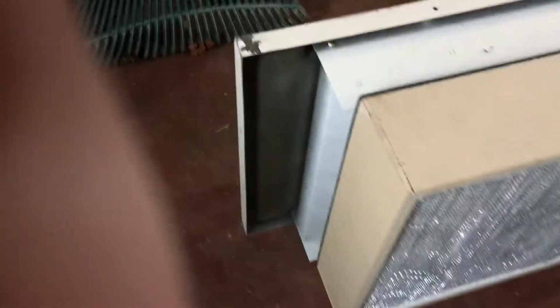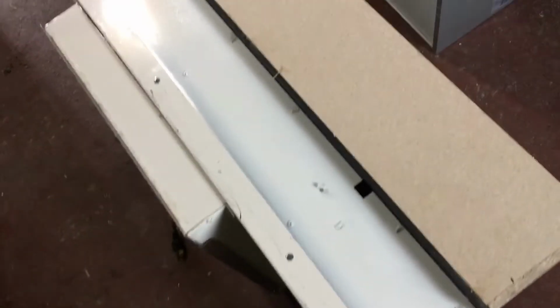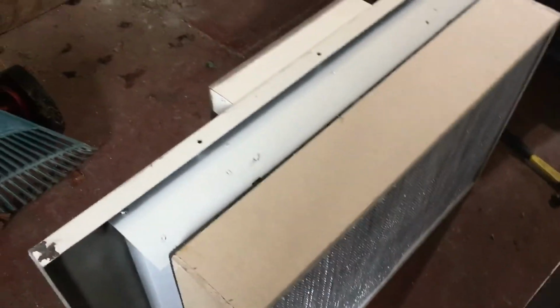Anyway, thought I'd give you some feedback, Eric. If you haven't cracked your modular filter open, you're probably in for a surprise, man. It's nasty. I'm not even gonna bust into the rest of this until I figure out how I'm gonna tackle it, what I'm gonna do to adapt this, because I might just scrap the whole thing. But I do like the low profile design.